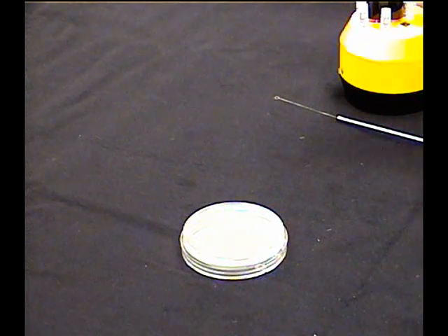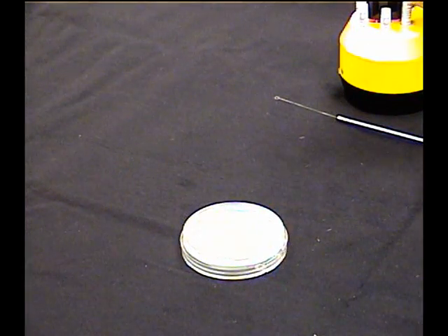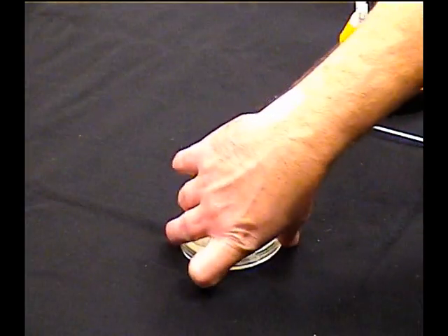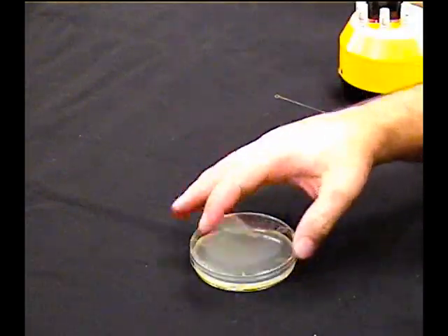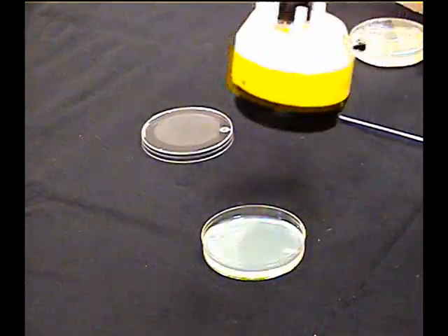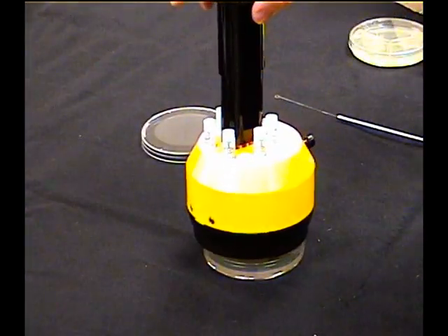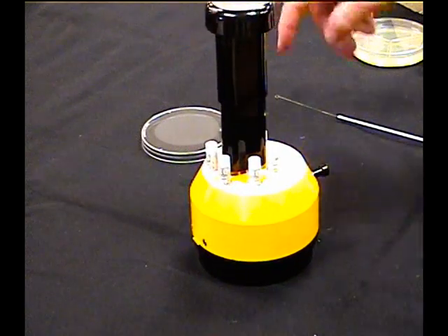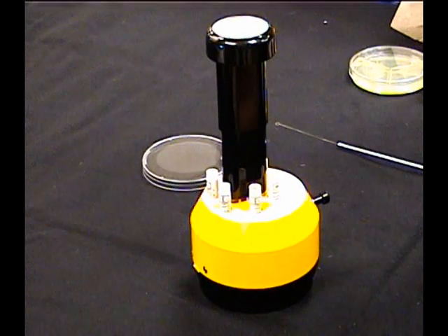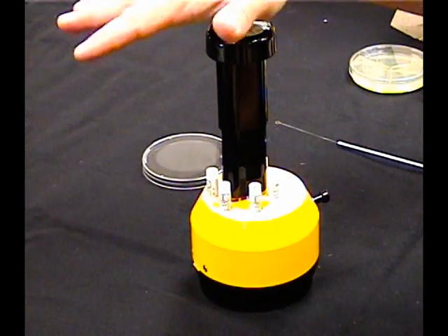Once you're done with that, you need to apply the discs. How are we going to do that? Turn it right side up, take the lid off, and set the dispenser right over the top. Remember, I took the lid off. Otherwise the discs just wind up on the lid and it does us no good at all.